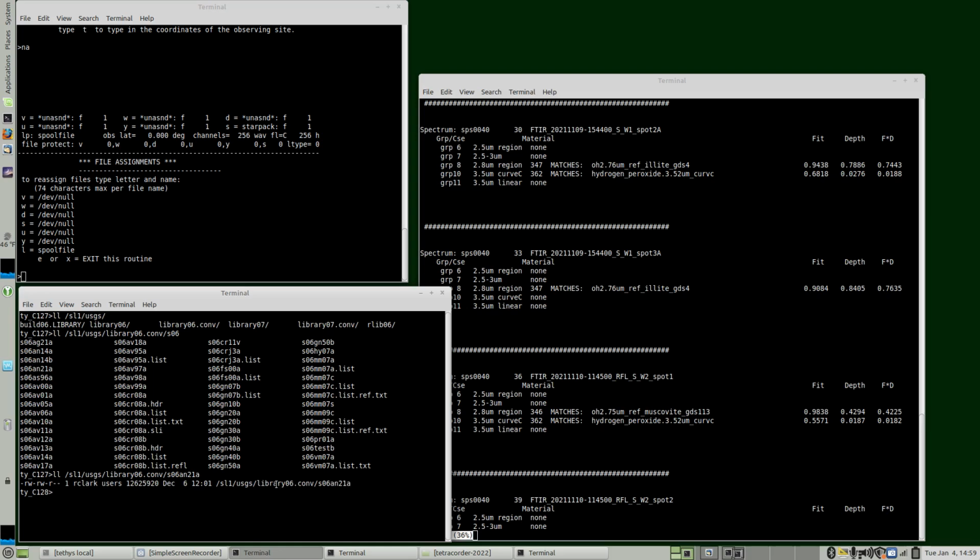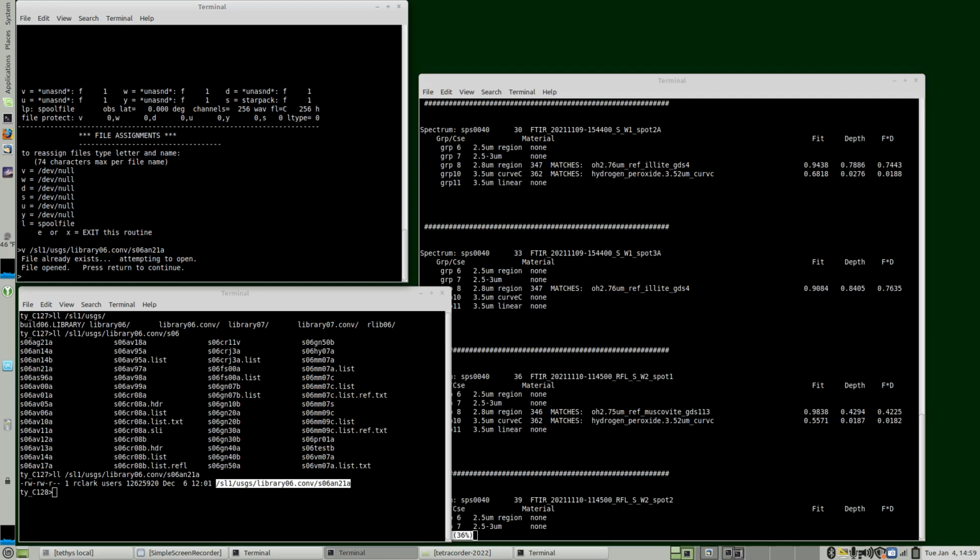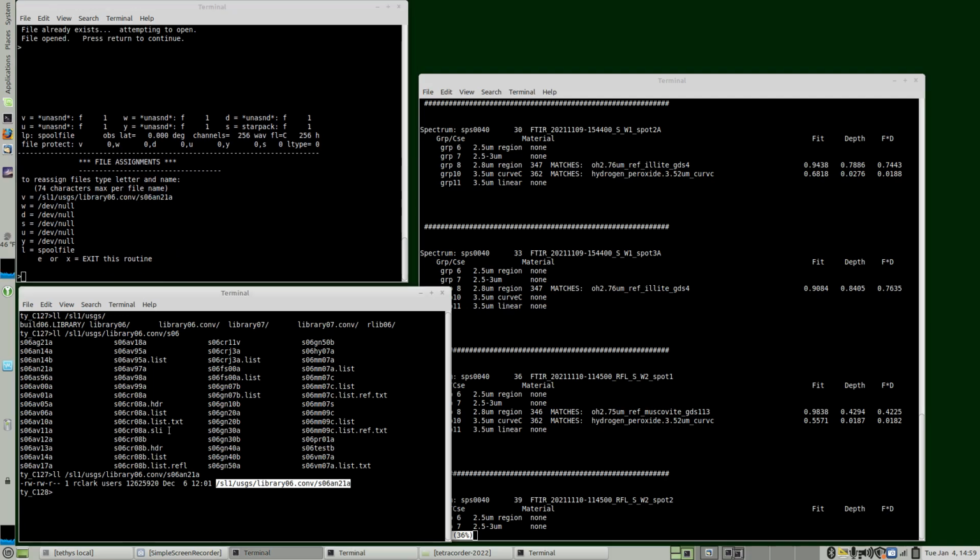So that's the spectral library. We'll come up to this other window, assign it to V, and it found it. That's good. Now let's go and find, let's see, this one. The research spectral library, R06AN. No, excuse me. AN is AVIRIS NextGen. We want AG, so we've got to find AG.